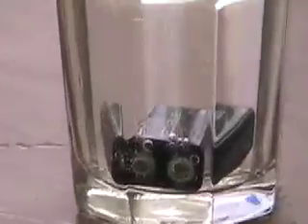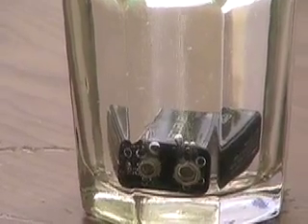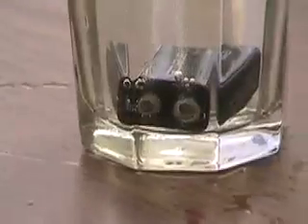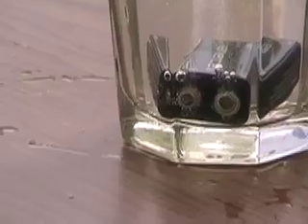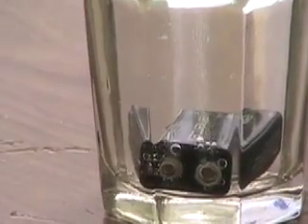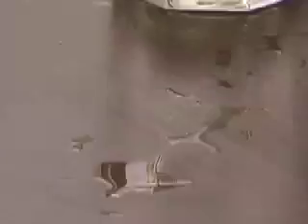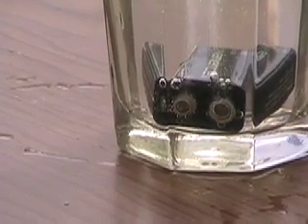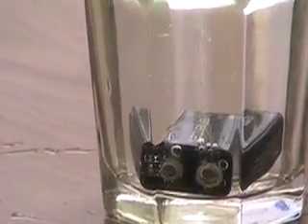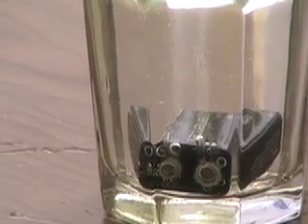This is using up the battery very fast and uses a huge amount of energy. This is how hydrogen is created on a commercial scale. What may be of interest is that deuterium, a heavier isotope of hydrogen with an extra neutron, when it forms water, it's harder for it to get split apart by electrolysis. Therefore, when you fully split apart a whole glass of water, what's left is a slightly higher concentration of deuterium oxide, or deuterium water, or heavy water. That's how they commercially make deuterium water, which is used mostly in nuclear reactors to moderate nuclear reactions. But here we've got elemental hydrogen and elemental oxygen coming out — this is too little for me to really burn, but it's still pretty cool.